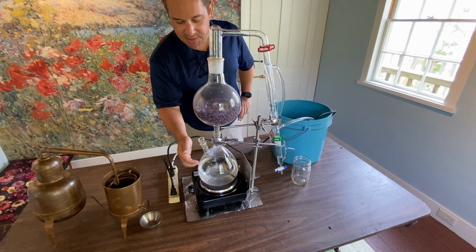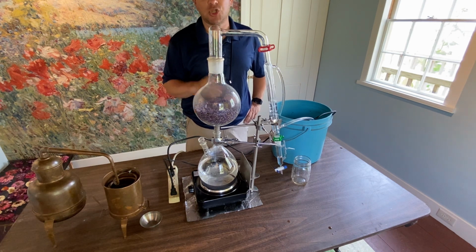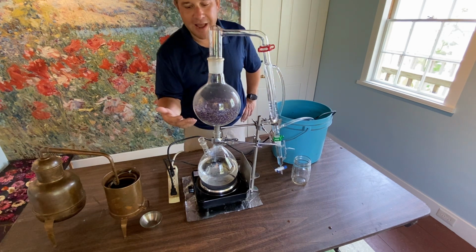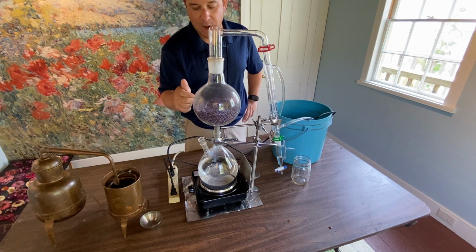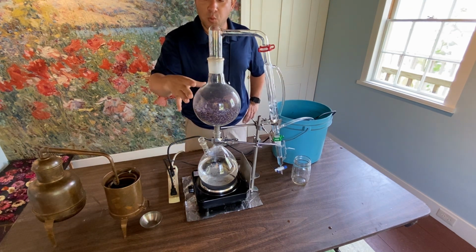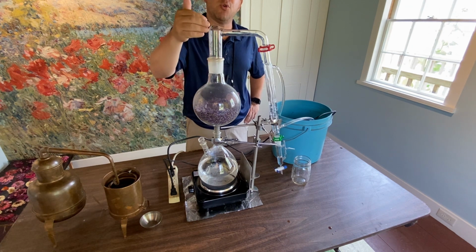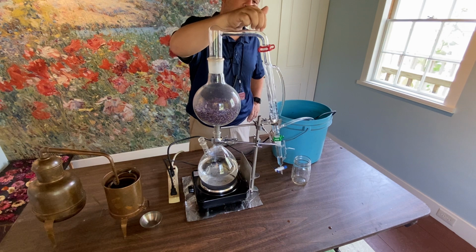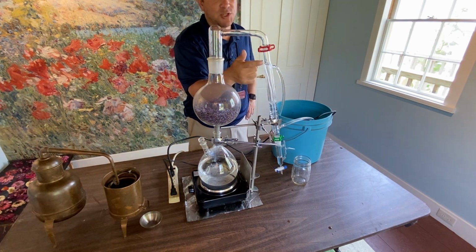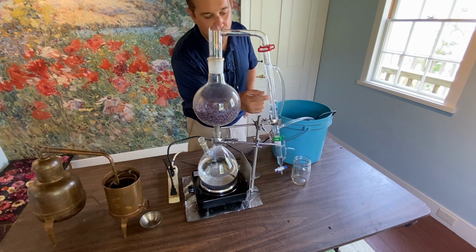Now, once I get this simmered, things will start happening. On average, this takes about 2 hours for the amount you see in here. I have maybe 4 to 5 ounces of just lavender flower. So essentially we're trying to draw steam through plant material, and then with a little heat and pressure, that steam and that heat will basically pull the oils out, delivering up to this section and then hitting this more modern condenser. As you see, we have circulating water around this double condenser.